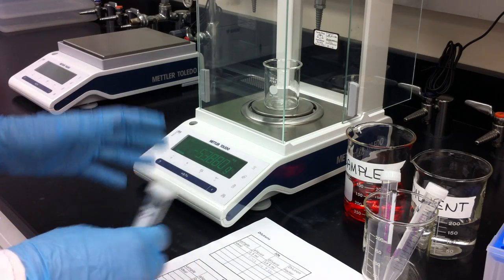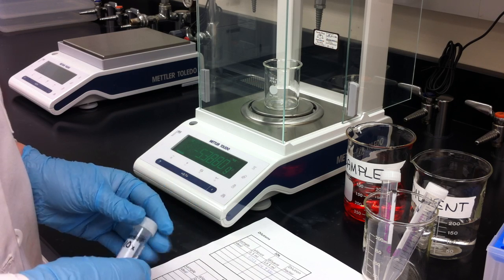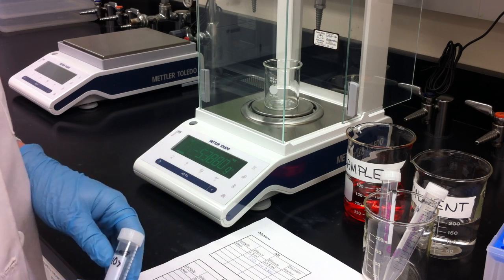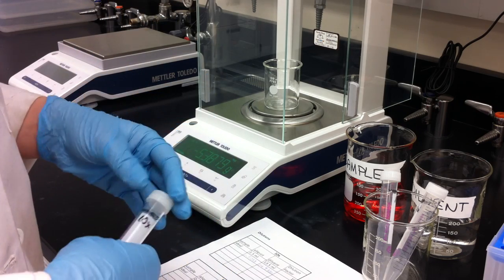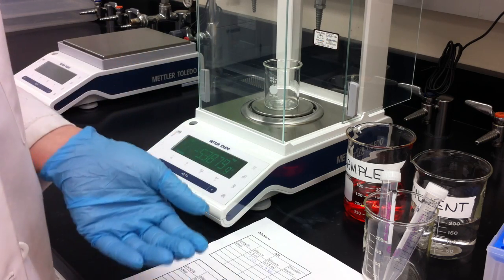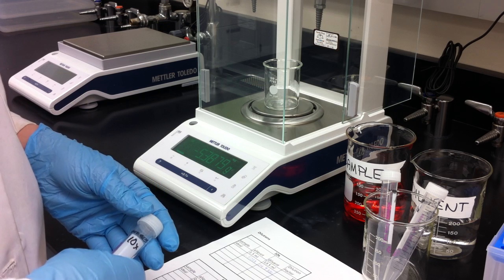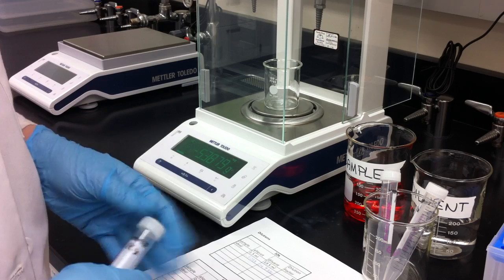Okay, we're going to talk today about how to do analytical dilutions. And the first thing, the way that I like to do them, is to do both by mass and by volume. So I add things by volume using pipettes, but then I also weigh them. And that, to me, gives a much more accurate way to dilute things than any other way.